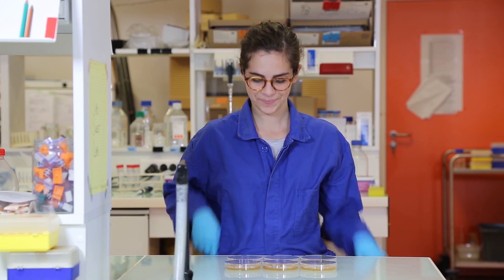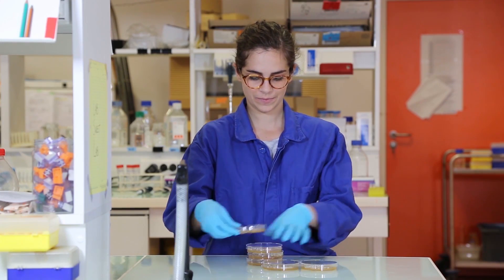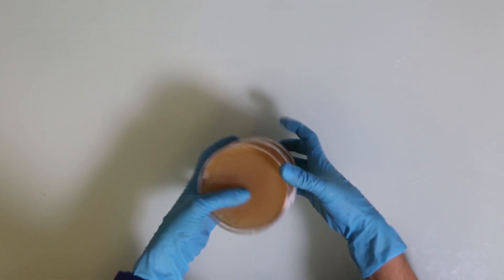After a few days in the incubator, we can count how many colonies we have on each plate and estimate the total number of CFUs per gram in the original yogurt.